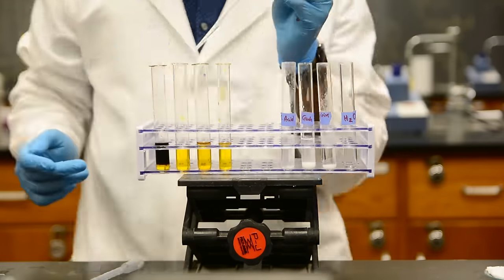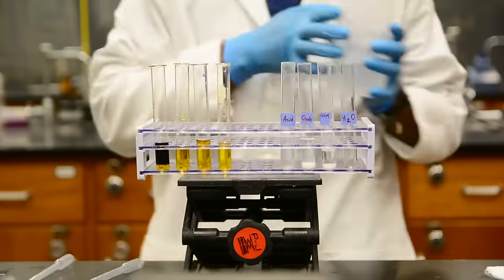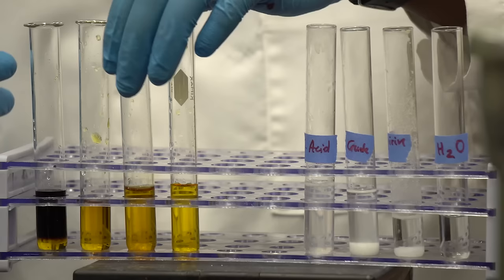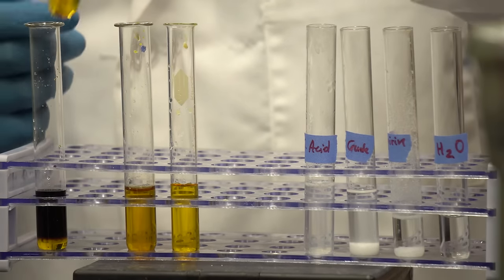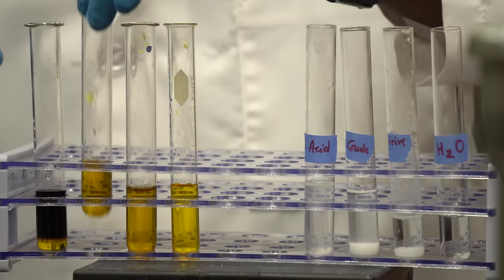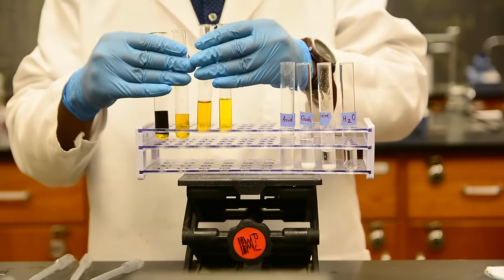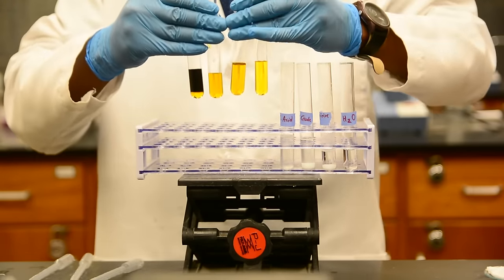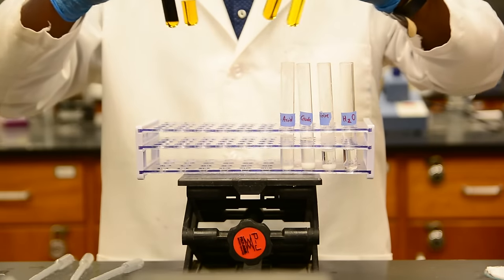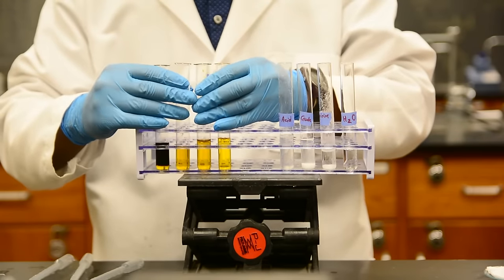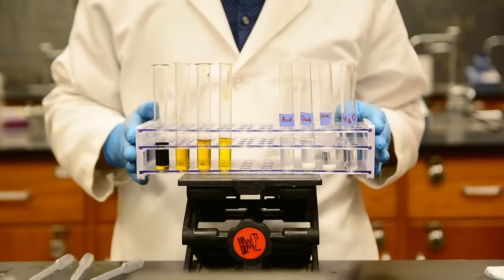Now, after adding FeCl3 to each of our samples, let's look at the results. The starting material turned purple, as expected. Then the crude product may turn purple, which would mean that there is still some starting material in there, but it may not if the product was cleaned enough that no significant impurities reside even within the crude product. The pure product, as you can see, is brown, which is good news. That means that we have successfully made aspirin and adequately purified it from the starting material. The control here is also brown, meaning that our test works as expected.